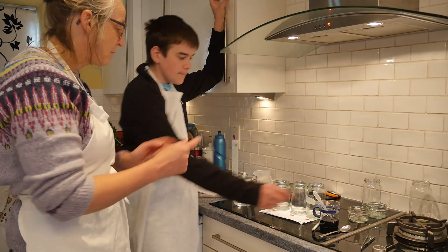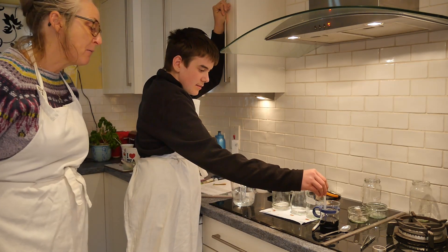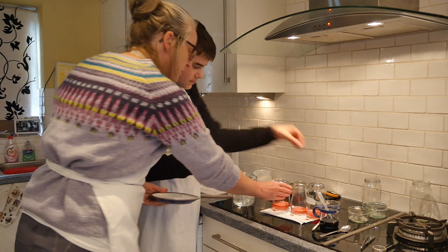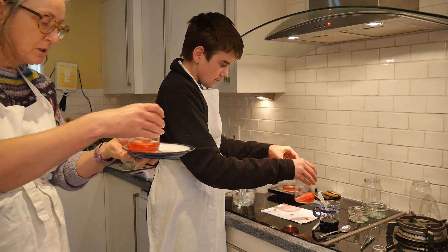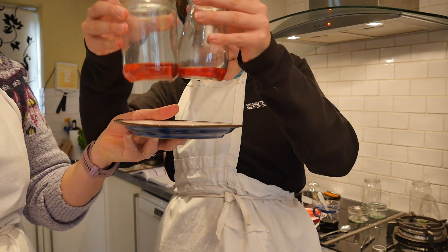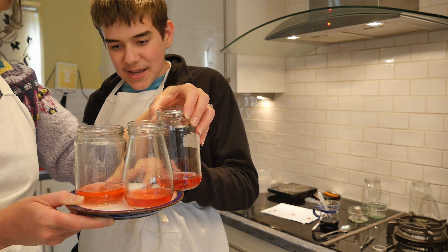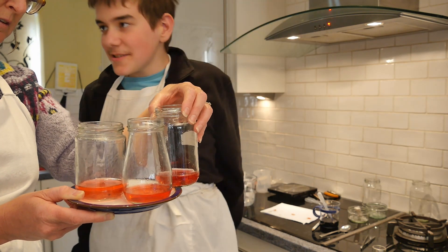We are getting a slightly stronger acid, but it's not very noticeable. It's what you call a wide range pH indicator, so it's difficult to test over the narrow range we have here since it goes from 1 through to 14. Now we add the red cabbage indicator — put a fair amount in and give it a good swish. We are getting slightly different colours. The two weaker solutions are very similar, but the one molar is clearly a darker red.